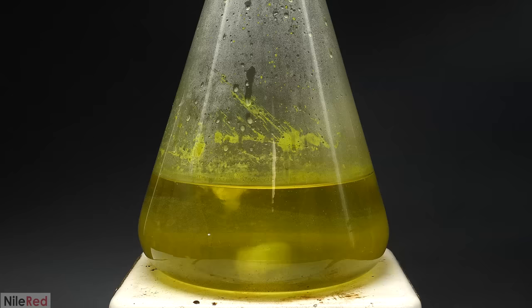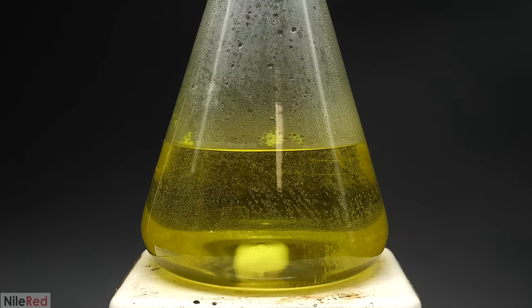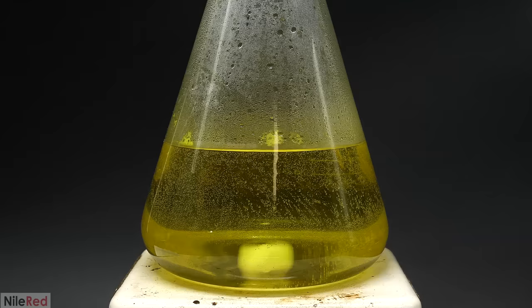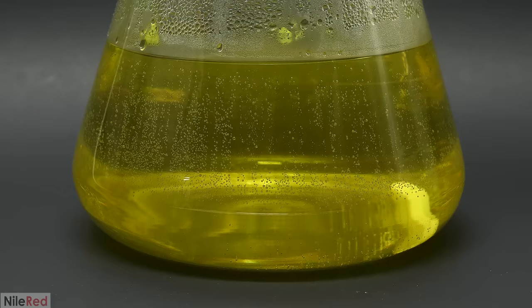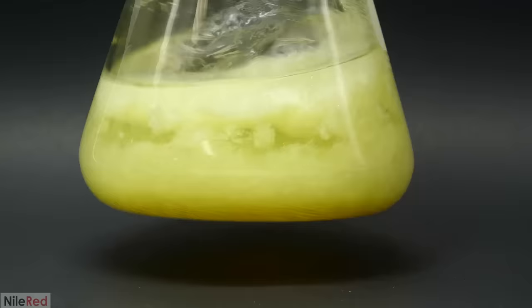So I just quickly transferred it to a larger flask and then continued adding more. It did end up clearing up completely but it also didn't take that much more water so probably everything would have fit in the beaker. I then took it off the hot plate, pulled out my stir bar and waited for it to cool down. When I came back the next day I had a lot of nice whitish yellow crystals but there was also a lot of this nasty junk on the bottom.